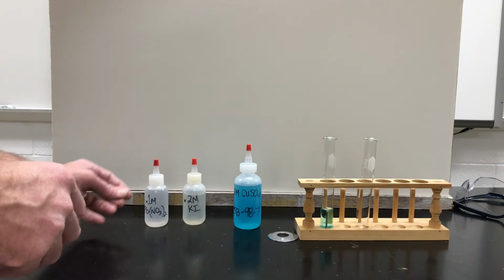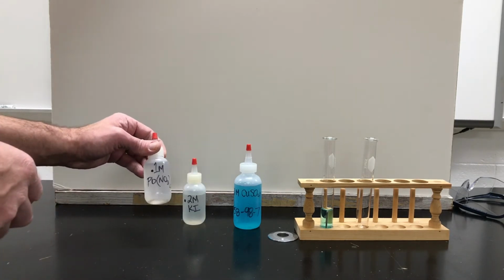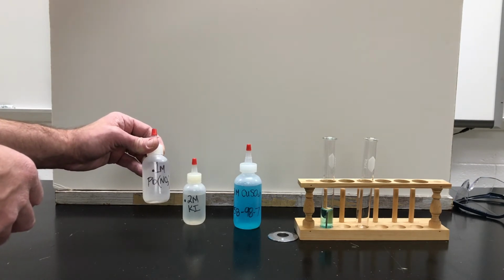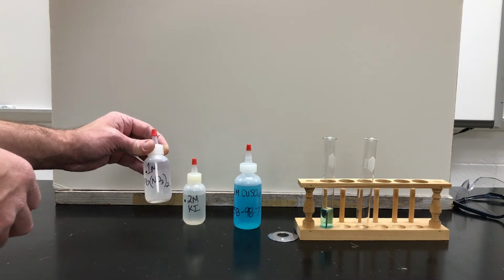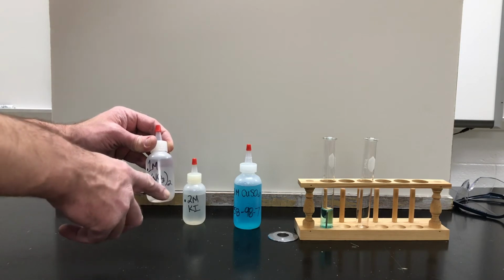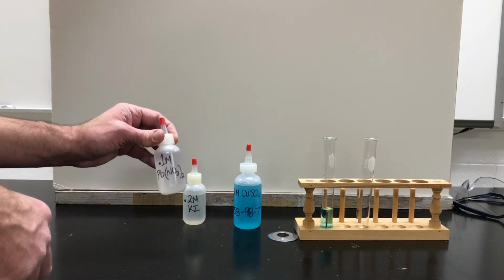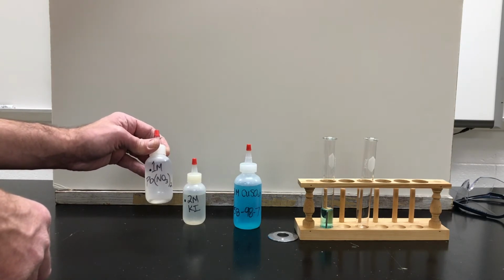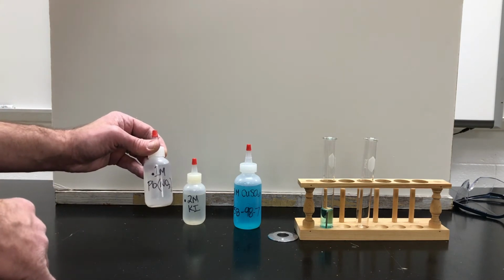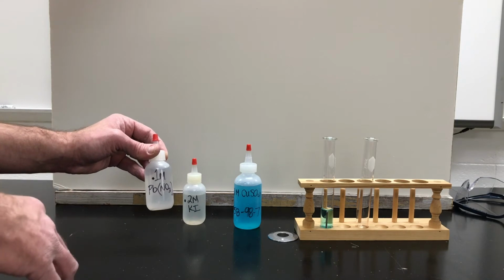The other experiment I want to do is mix two aqueous solutions. This particular solution is lead nitrate. Lead 2 nitrate, actually, because this lead's a +2 charge. And if you remember crisscross, you can see that there are 2 of the nitrate group, 1 lead, so that translated over. And that salt dissolved in water is clear and colorless. By the way, the 0.1 capital M is a way we show concentration in chemistry. It's called molarity. We'll worry about that later.